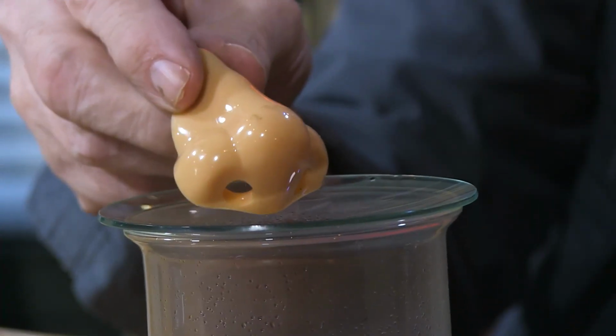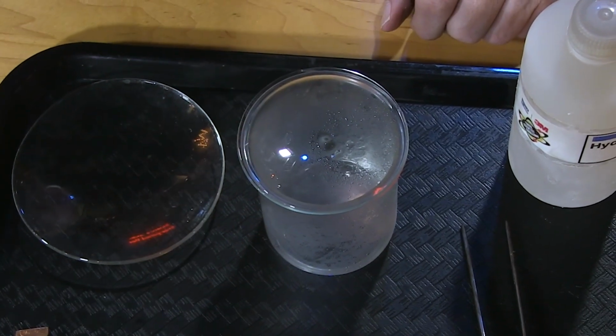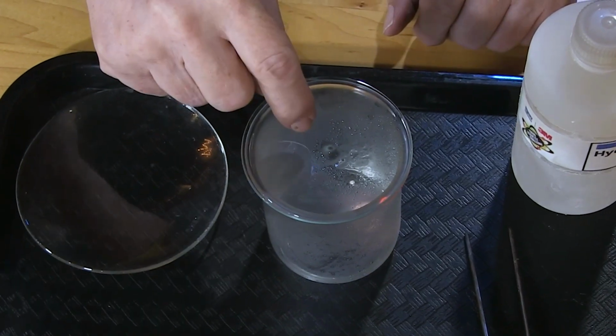This nose knows something's going on wrong here. I have this beaker, I have some concentrated hydrochloric acid. Now I've got some drops, the fumes have come up and collected on the inside. When I pick this up, I almost burned a hole in my hand. Came that close, but luckily the nose saved me.